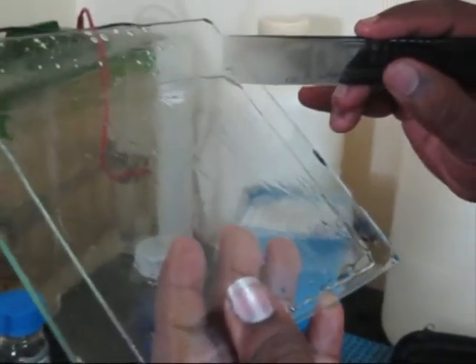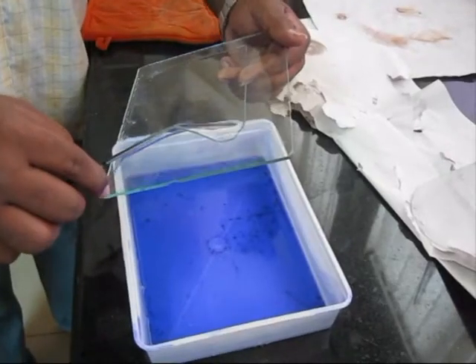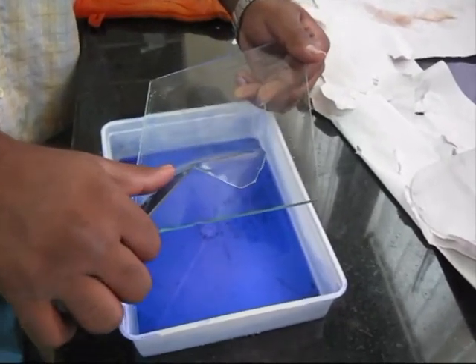A marking is made on the right edge of the gel. The gel is subjected to staining.